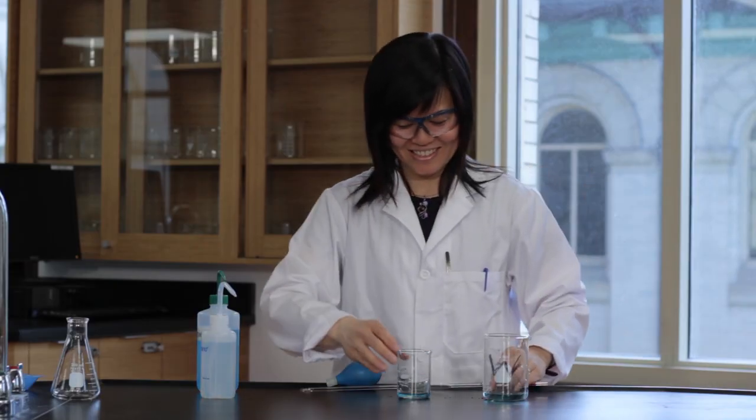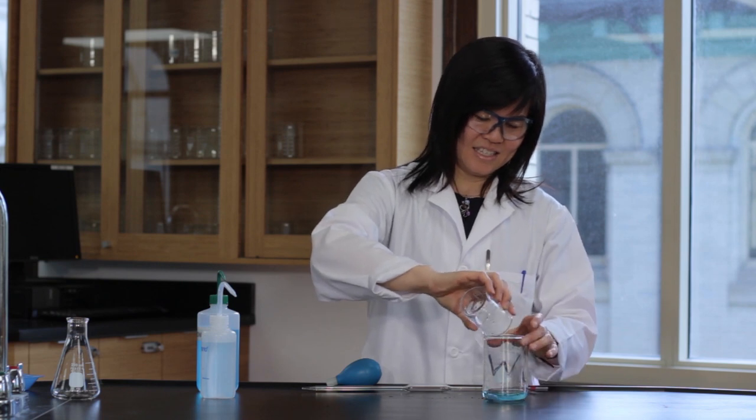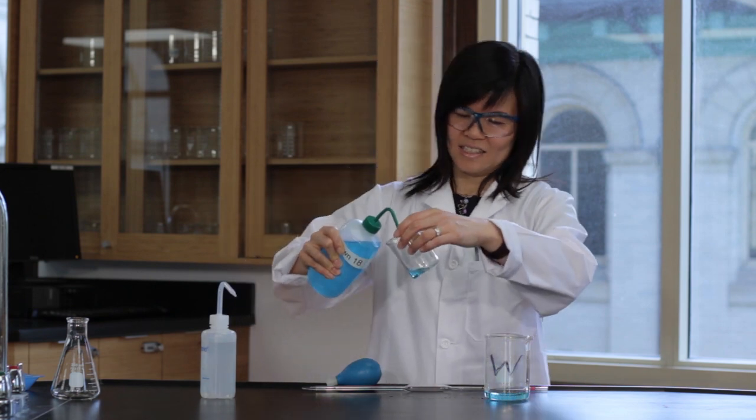Your pipette is now ready to be used. Discard the rinse and the remaining solution in the beaker as it is considered contaminated. Refill the beaker with approximately 50 milliliters of the solution to be pipetted.